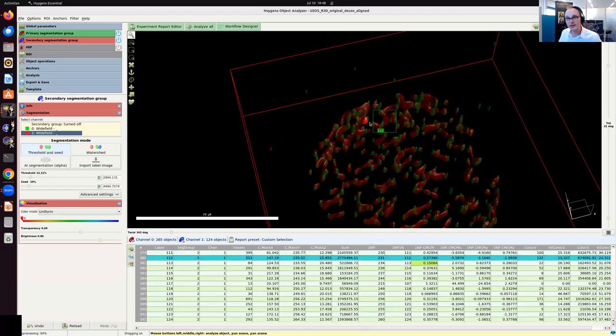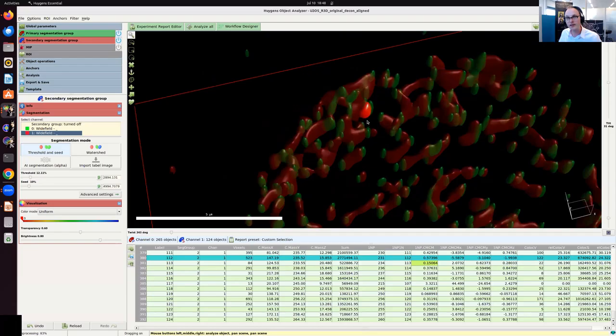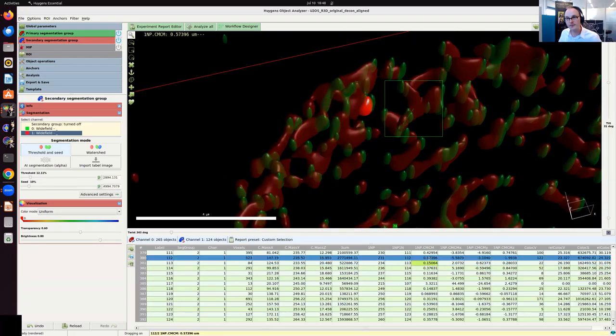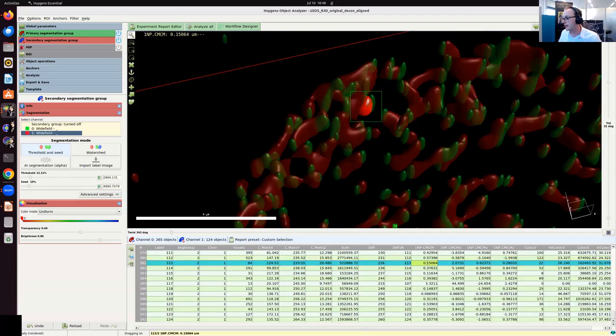And for example, if I click on this one, I can zoom in a bit, then here I can see both a line, I can see the object lit up, and I can see a little green line, which is the distance. So in this case, 150 nanometers.